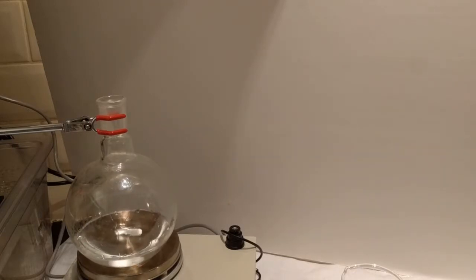You turn on the heating and the stirring and place the preloaded Soxhlet Extractor. As you'll see in a moment, I've filled the Soxhlet Extractor with lemon peels, and there's a bit of cotton on top and a bit of cotton on the bottom. There are too many lemon peels in it, I can already tell you in advance. I made a slight miscalculation, and as a result, somewhere in the middle had to remove some.